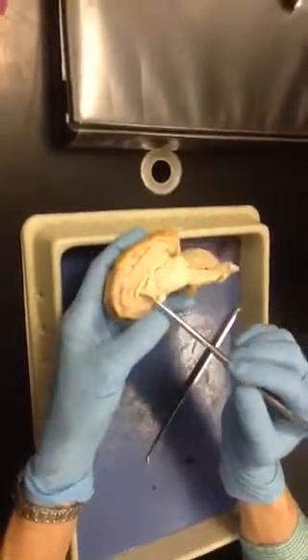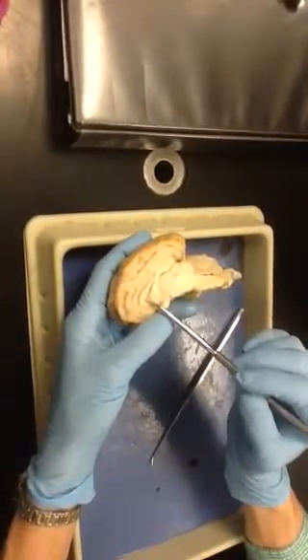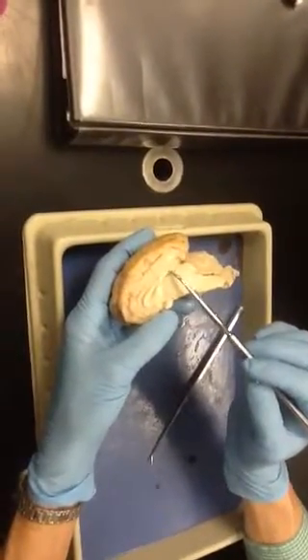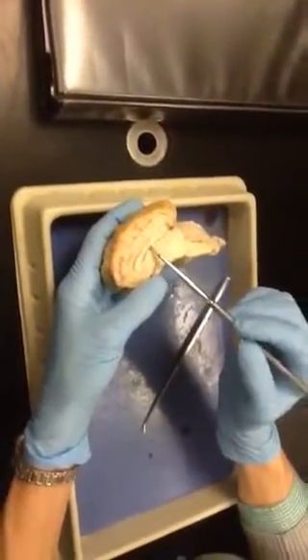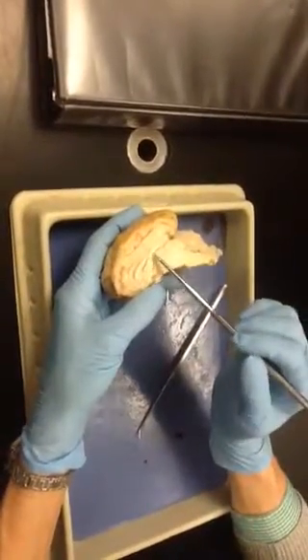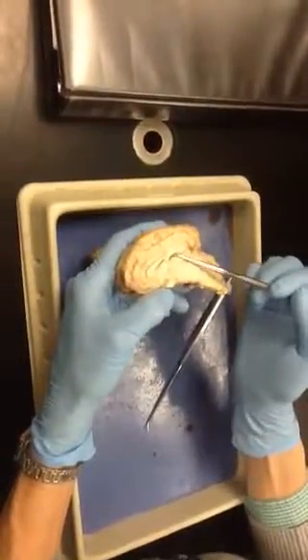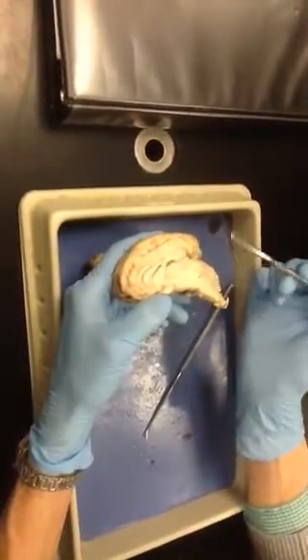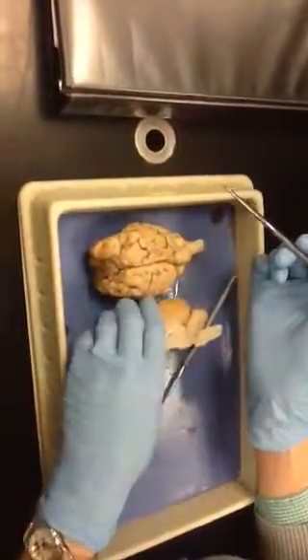Okay, corpus callosum, the genu is at this end, the septum pellucidum is here, the splenium is this end, the floor of that ventricle is called the fornix. Underneath there is the third ventricle, and in that third ventricle is that gooey red stuff. That's the choroid plexus.